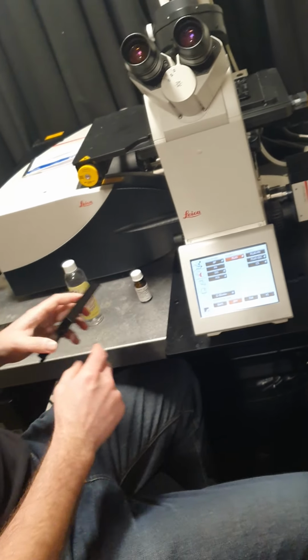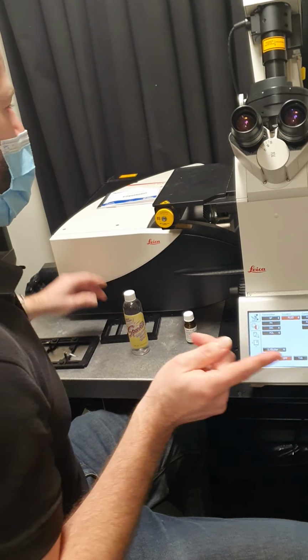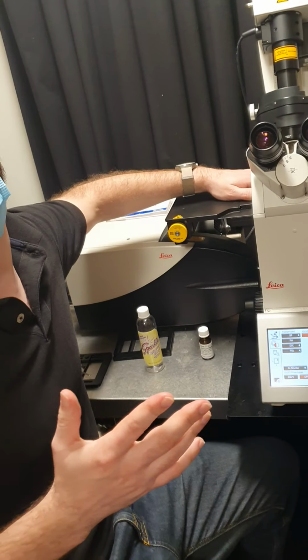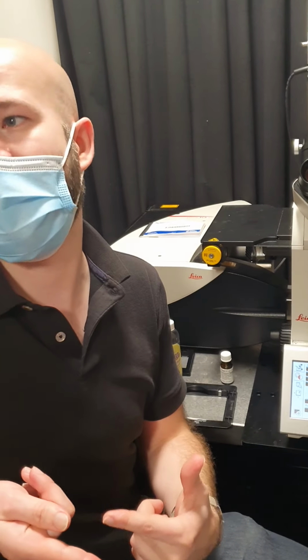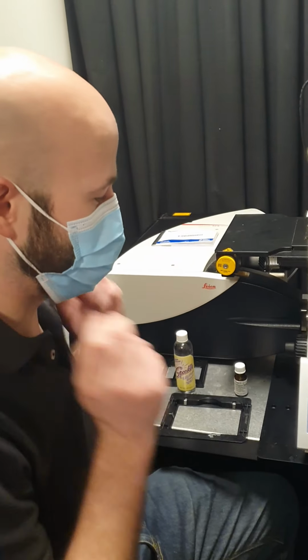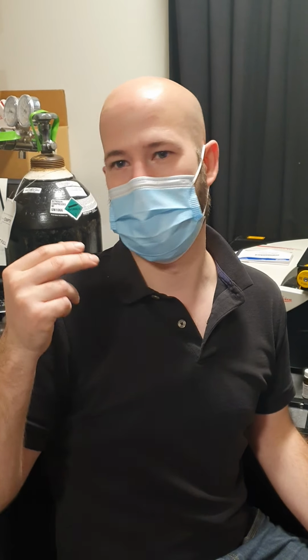So slides should be inverted? Yes, that is a very important thing, and that is something that sometimes people get wrong. It's an inverted microscope, so you want the cover slip facing down, which is particularly important with those confocal objectives which have the short working distance, because if the slide's the other way up, the higher magnification objectives won't be able to focus all the way through the slide, because they're designed to just be focusing through a very thin cover slip.